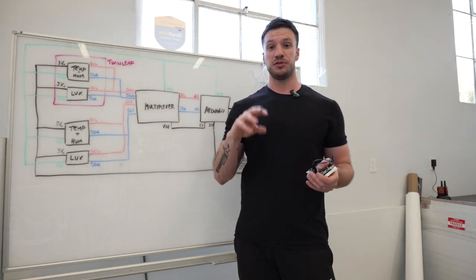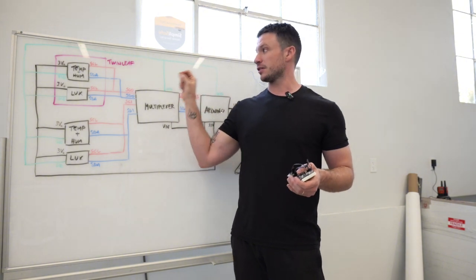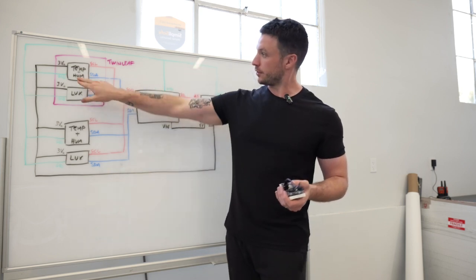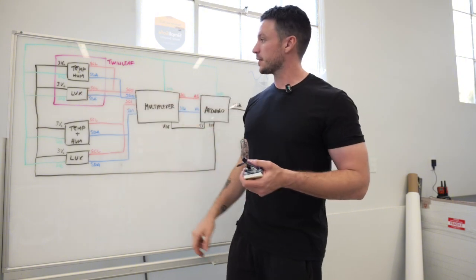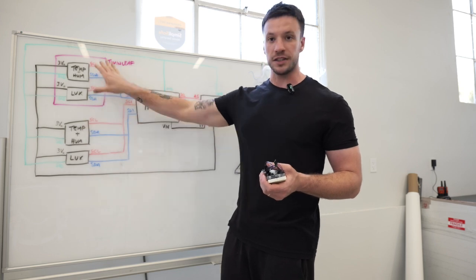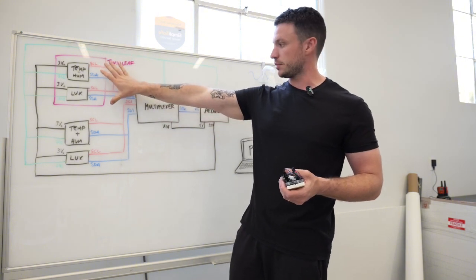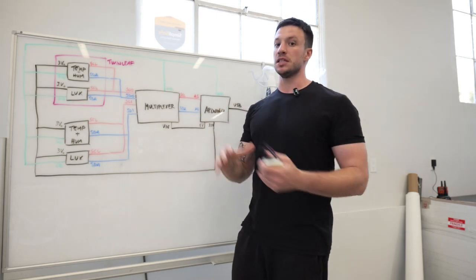We're gonna have two different sensors, and one of the sensors is gonna keep track of temperature and humidity, and another one is going to keep track of the light. So you can see that temperature and humidity and lux, which is a light sensor. And basically the idea is to have two sets of these, and one is gonna be inside of the twin leaf, so the tiny hypomagnetic chamber, and one is gonna be used to measure simultaneously the control.